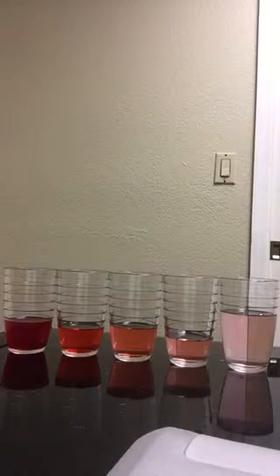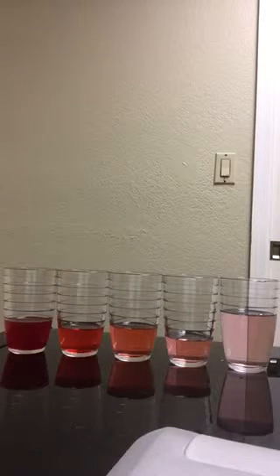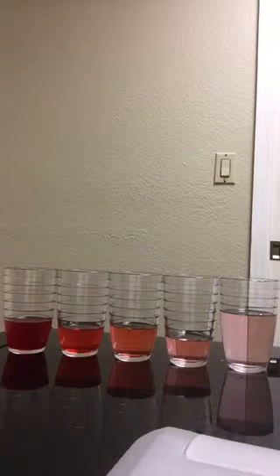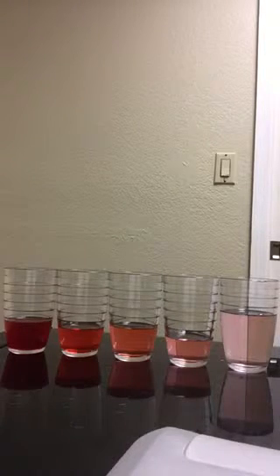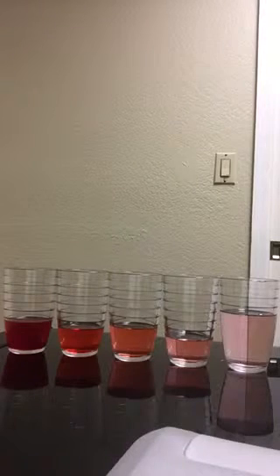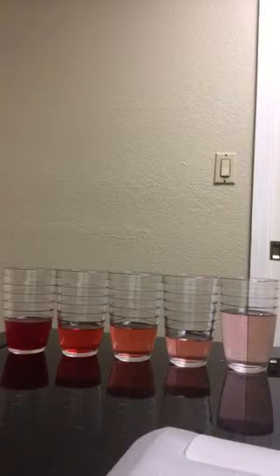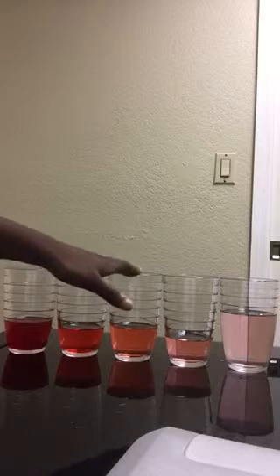Next, I transferred 50 milliliters from solution number 2 into cup number 3. I then added 150 milliliters of water. The dilution equation would be as follows: 0.012, the molarity of solution number 2, multiplied by 50 milliliters of solution number 2, divided by 200 milliliters, which is the total amount of the 50 milliliters transferred from solution number 2 and 150 milliliters of water. This gave me a total of 0.003, which serves as the molarity of solution number 3.